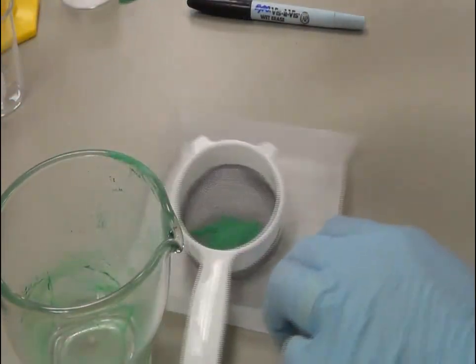Again, I am going to sieve in the mortar itself — I am just placing it here and tapping it with my spatula. As you can see, nothing remains, so I am sure I have uniform particle size. For example, if you are preparing a capsule or a suspension, this is the proper way to do it.